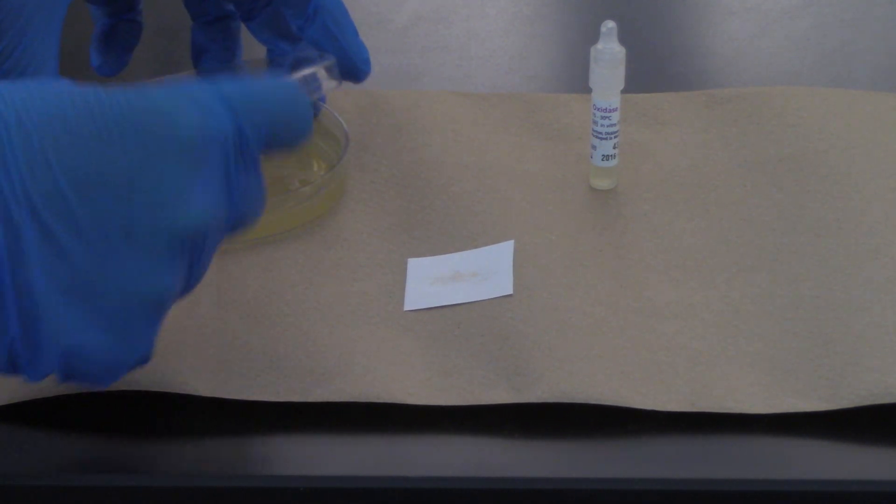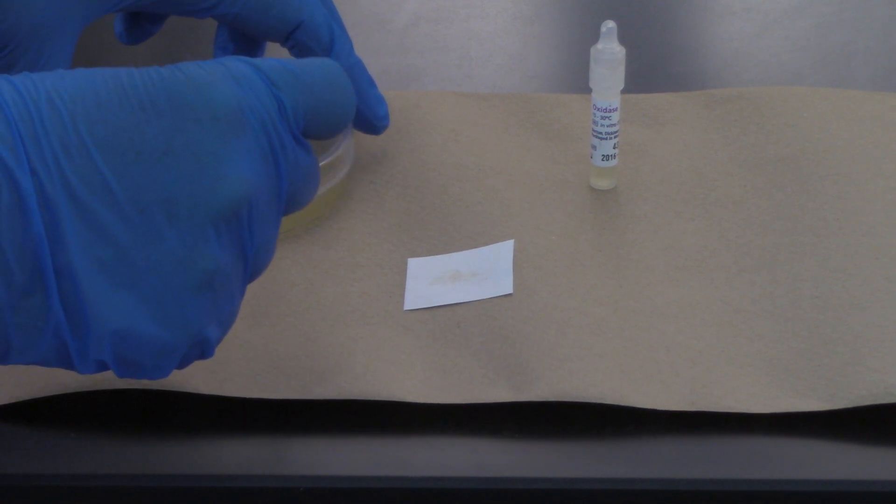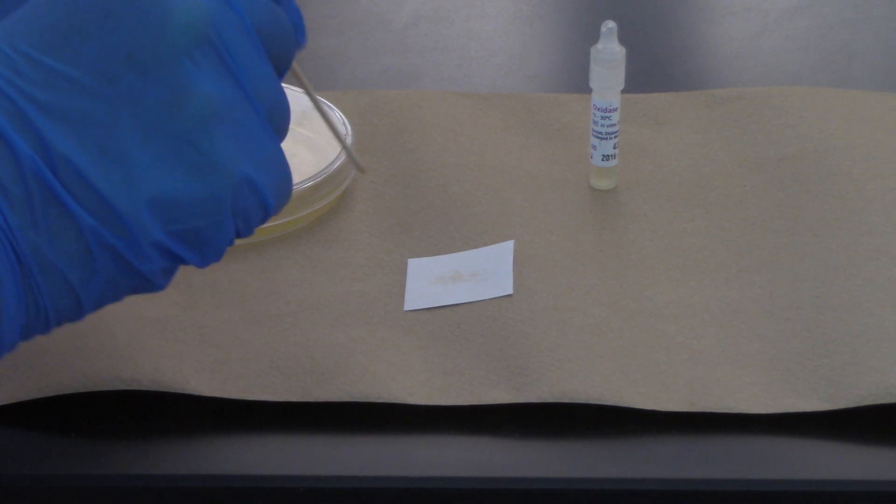I'm going to clamshell my plate and touch down to pick up just one colony. You can press if you need to. Do not grind into the agar.